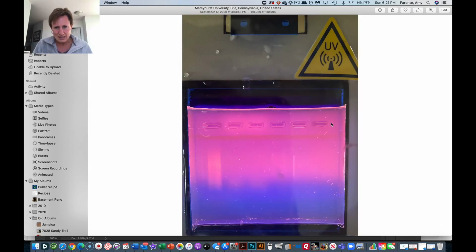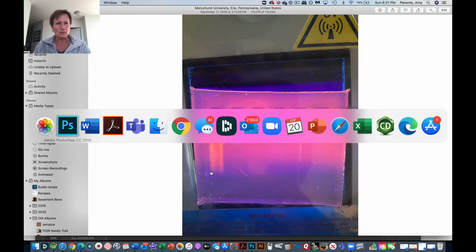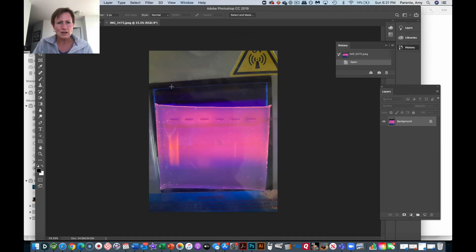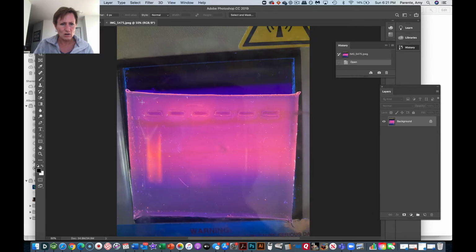But let's take, I think this one is actually, yeah, we're going to do that one. So I'm going to come back here to Photoshop. Let's just go through and do another one. Let's try this one. I'm going to do the same thing. We'll go a little bit more quickly now so you can just see. This really doesn't take long to do.